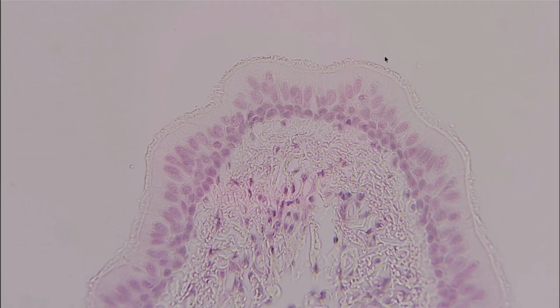And the reason this is called pseudostratified is because it looks like there's two layers, but there's really not. You can tell here, this looks like its own layer of cells, and this looks like its own layer of cells, but they're really just one layer. The way you can tell pretty easily is you can follow the cell wall here and try and make out where these cells are really coming from.